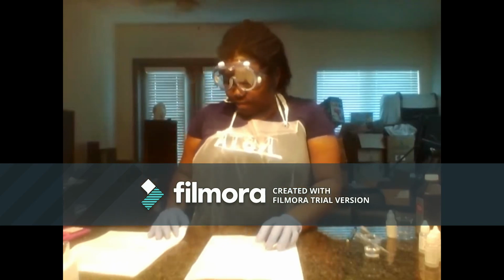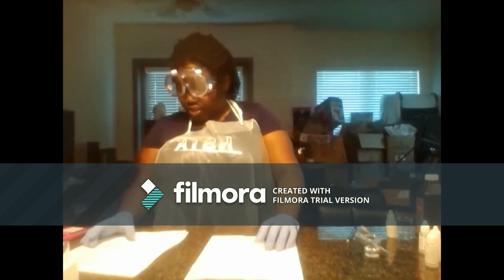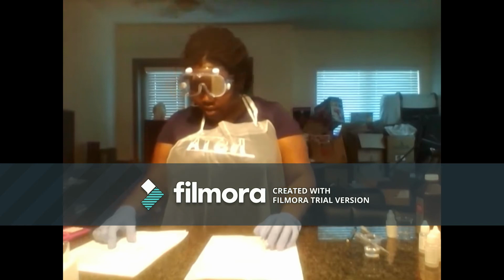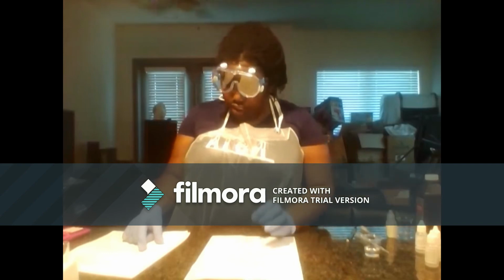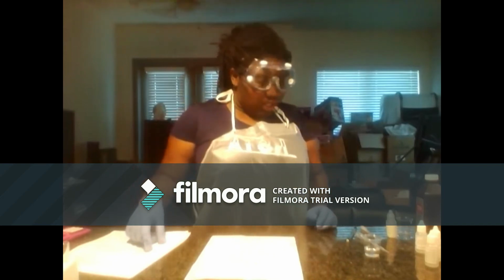Alright, so I've prepared my well plates for the concentration of hydrochloric acid. For my trials 1 and 2, there are 8 drops of potassium iodide, 2 drops of 100% hydrochloric acid, 4 drops of starch, no water, 8 drops of sodium thiosulfate, and I'll be delivering 0.4 mLs of hydrogen peroxide to start the reaction. And so I'll get started, and I'll come back once I've completed this trial.